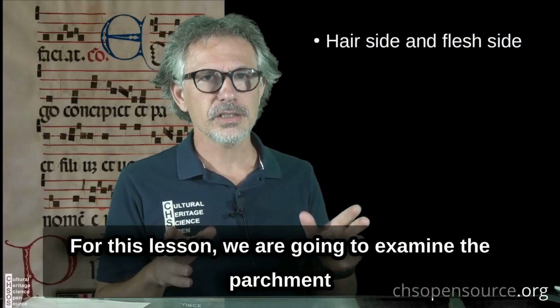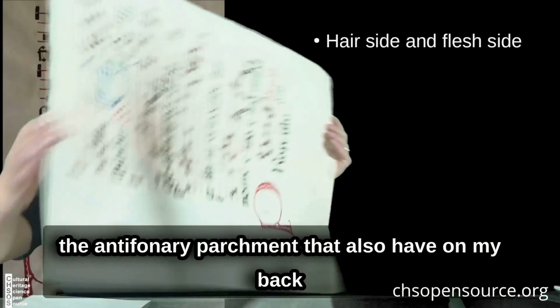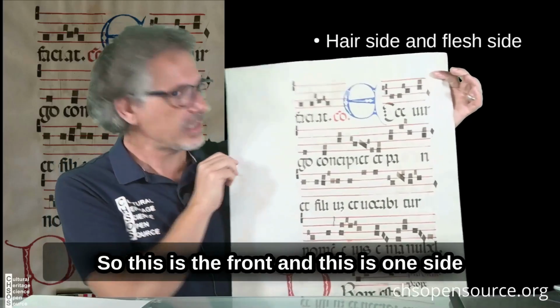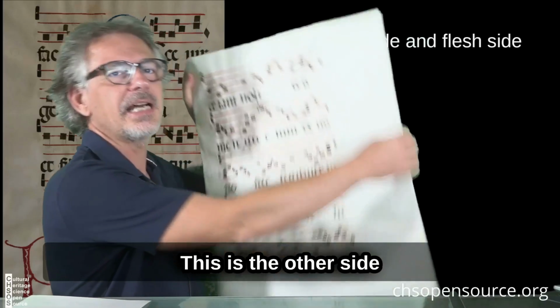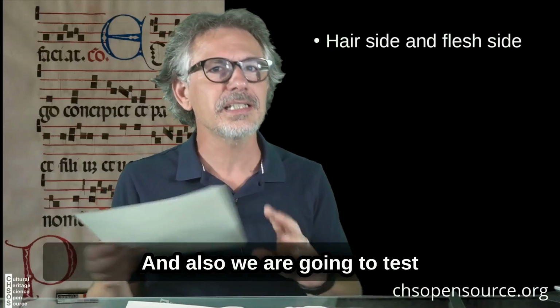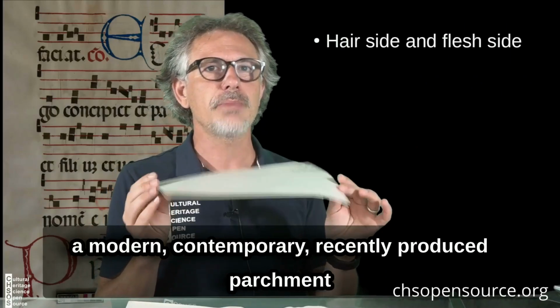For this lesson, we are going to examine the parchment, the antiphonary parchment that I also have on my back. So this is the front, and this is one side, this is the other side. And also we are going to test a modern, contemporary, recently produced parchment.